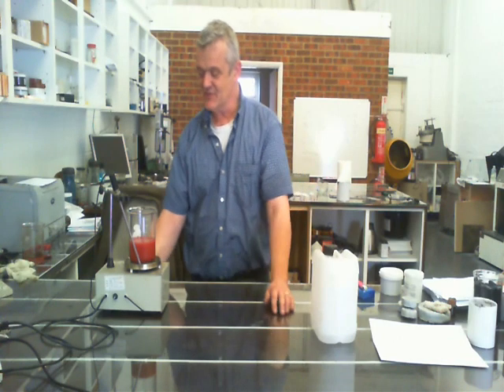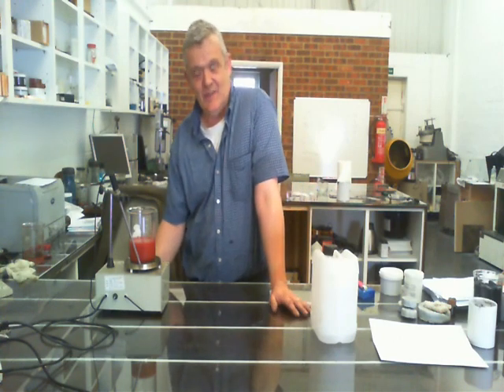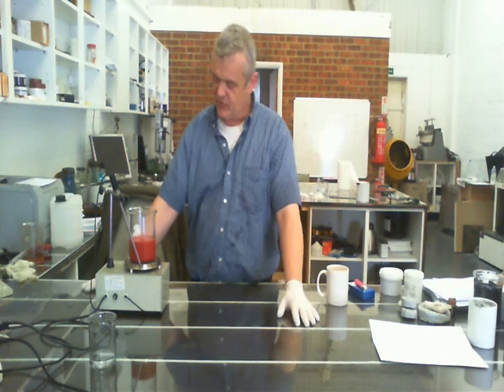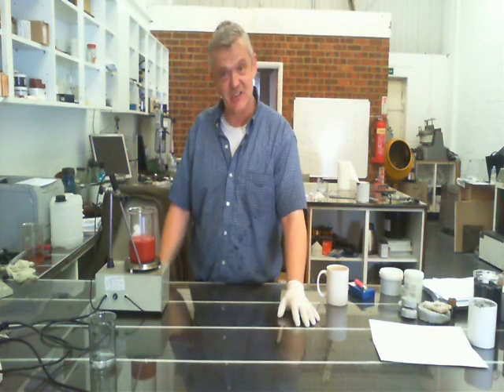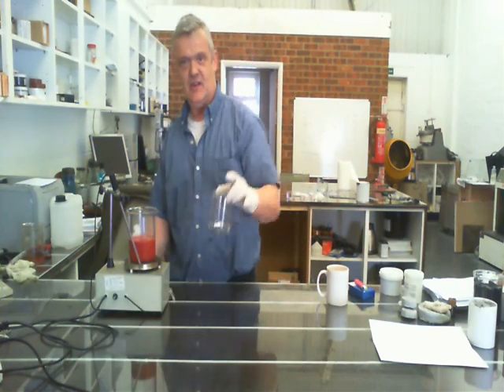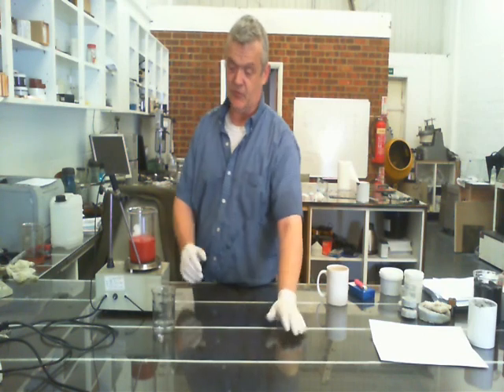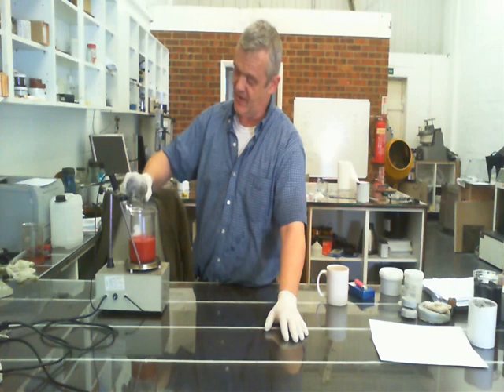All you do is give that a stir for half an hour until it has thoroughly mixed through in the gelatin solution. Here we are 20 minutes later, and as you can see that's mixed up rather nicely — the whole thing is distributed throughout the gelatin. What I've got here is 40 millilitres of 85% formic acid, and all I do is add the formic acid to that.